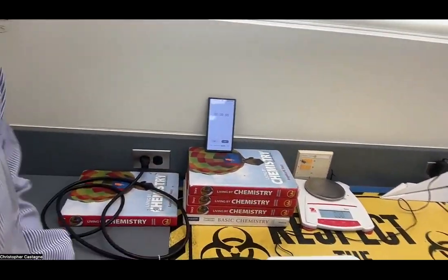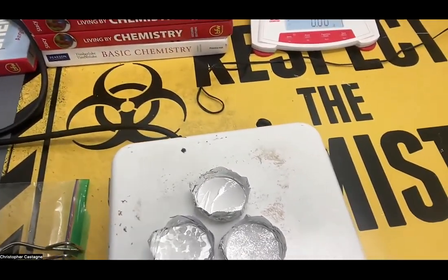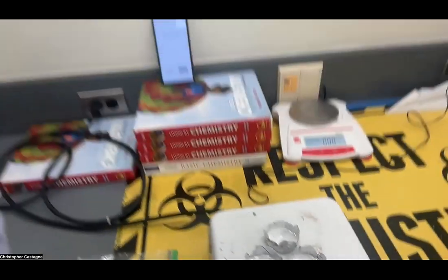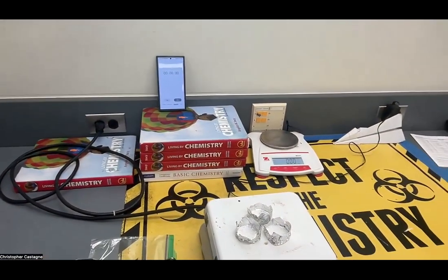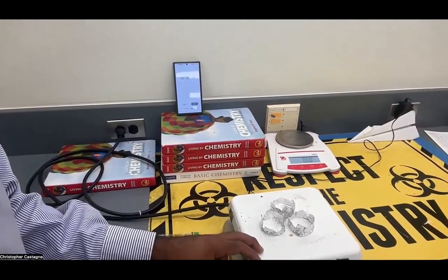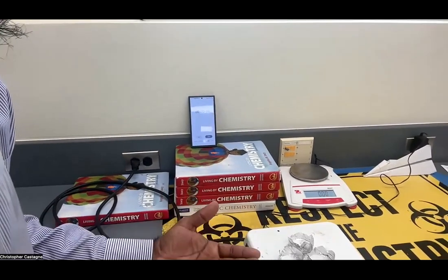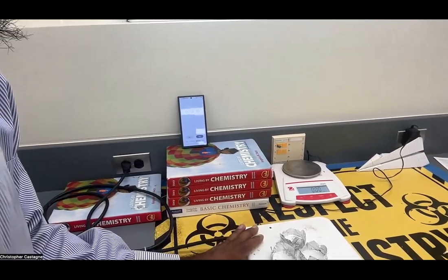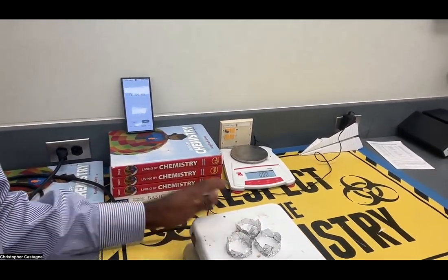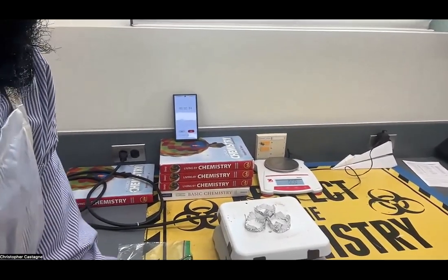In terms of accuracy: we want about the same amount of substance, with the same coverage of the base, spread around rather than piled up. We want to put all three on at the same time, because if we did one first and then took it off and did the other, the hot plate would already be hot from the first one, which would be unfair. For a fair trial, we need to put them all on at the same time. I'm starting my hot plate from cold.